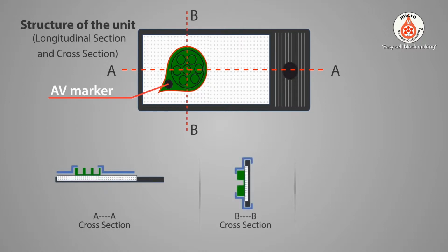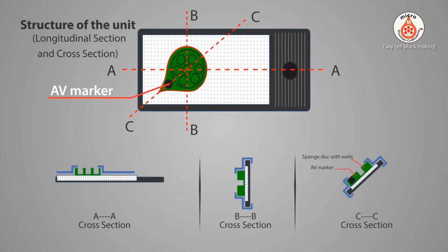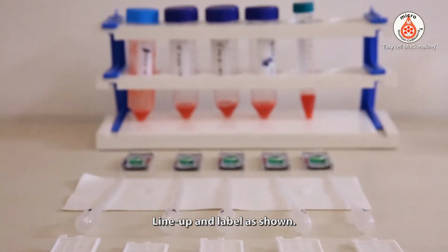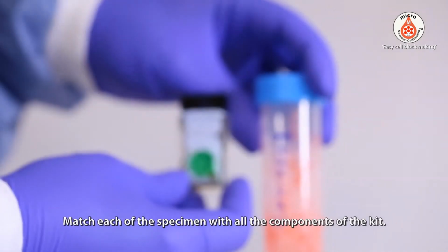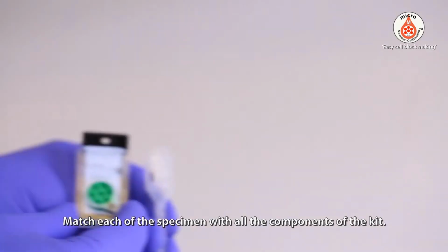Structure of micro unit explained with longitudinal and cross sections. Line up and label as shown. Match each of the specimens with all the components of the kit.